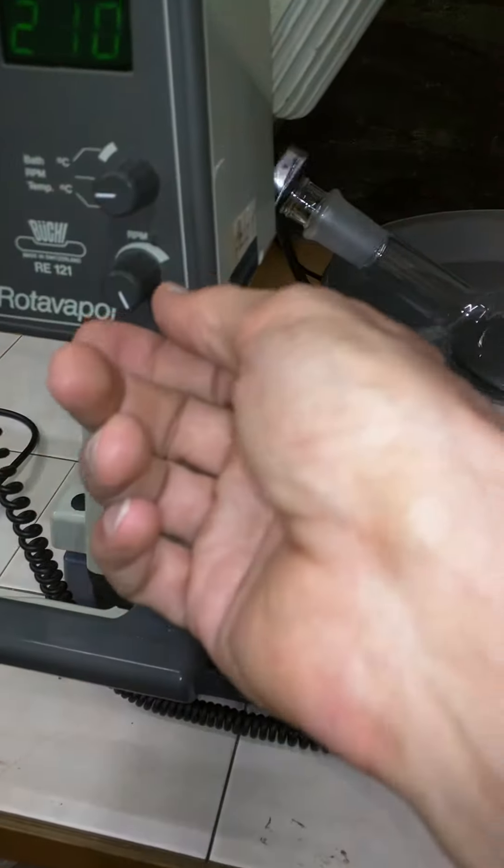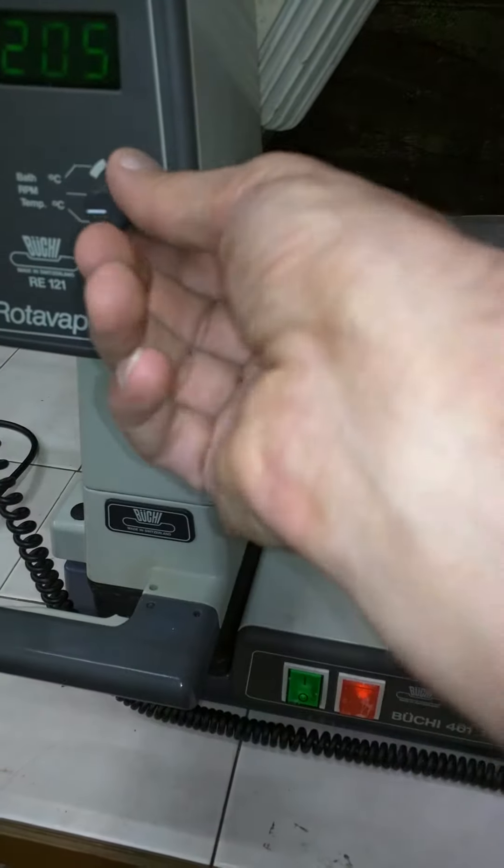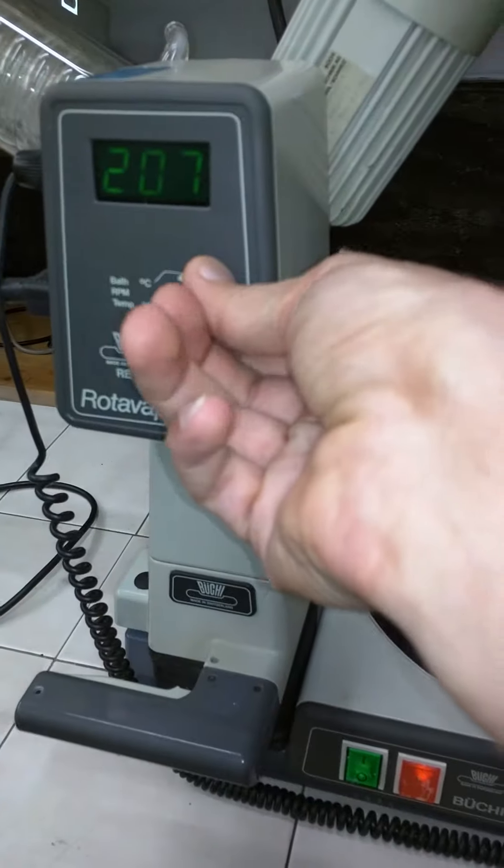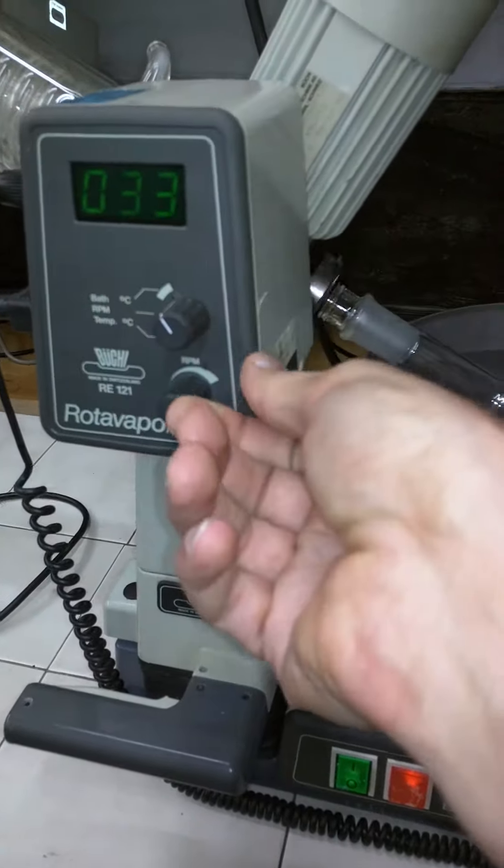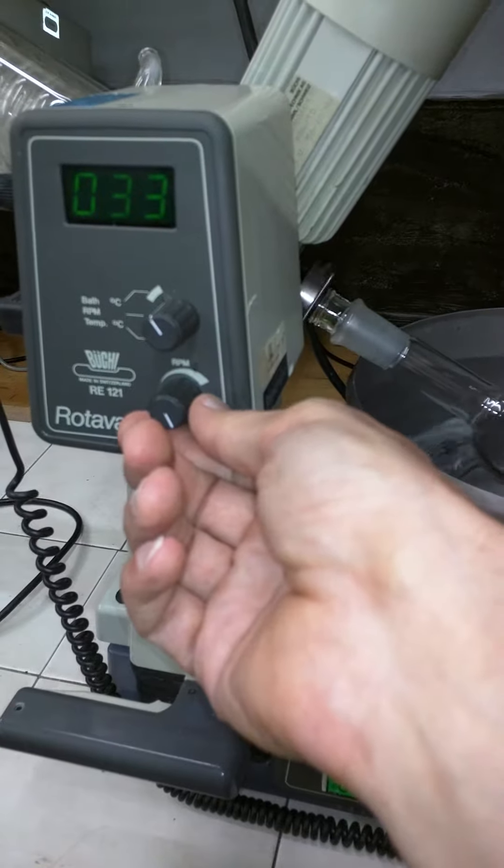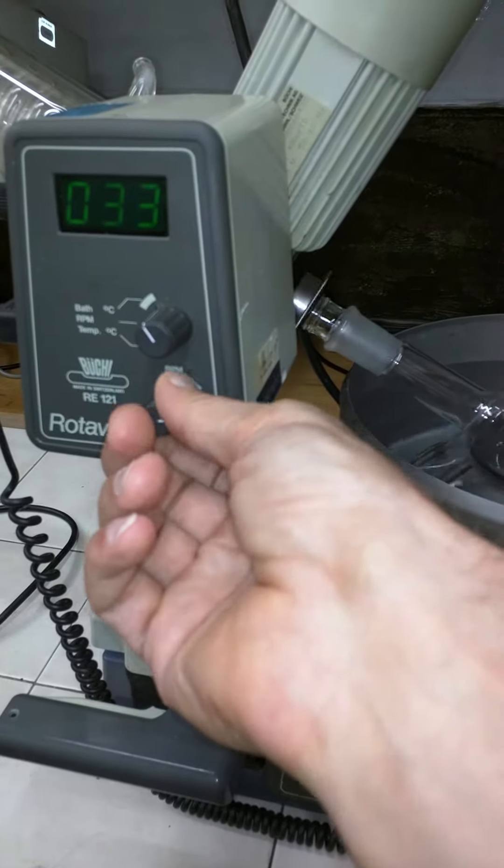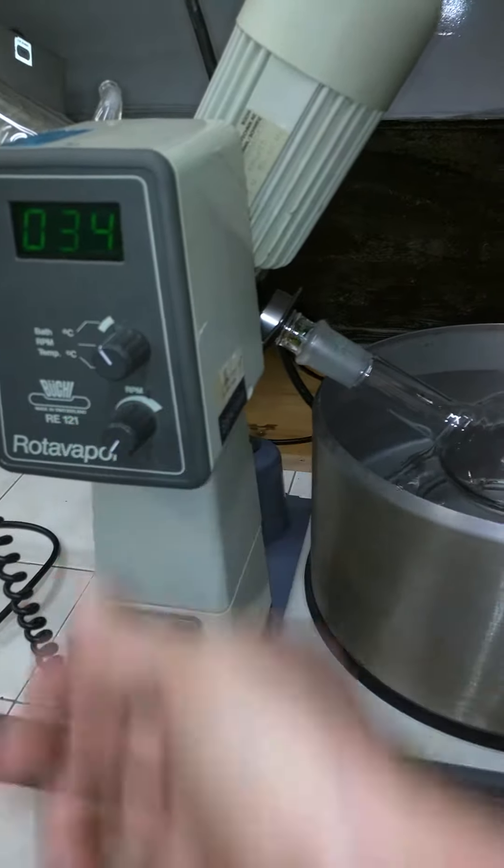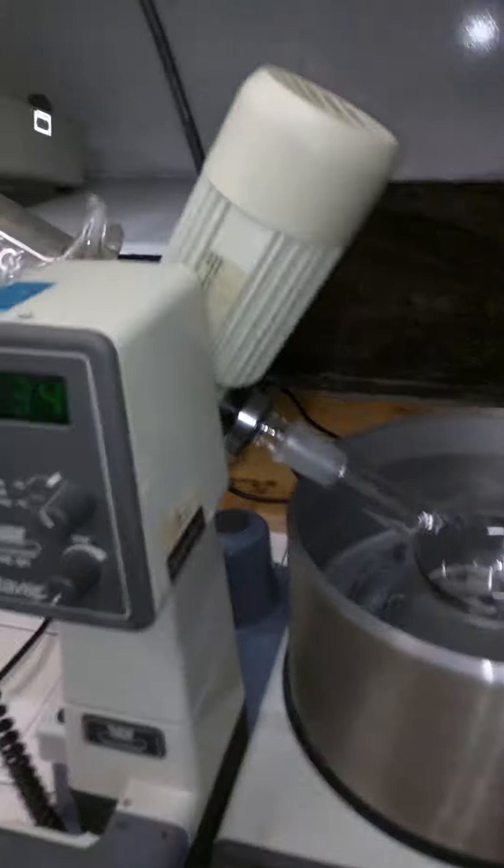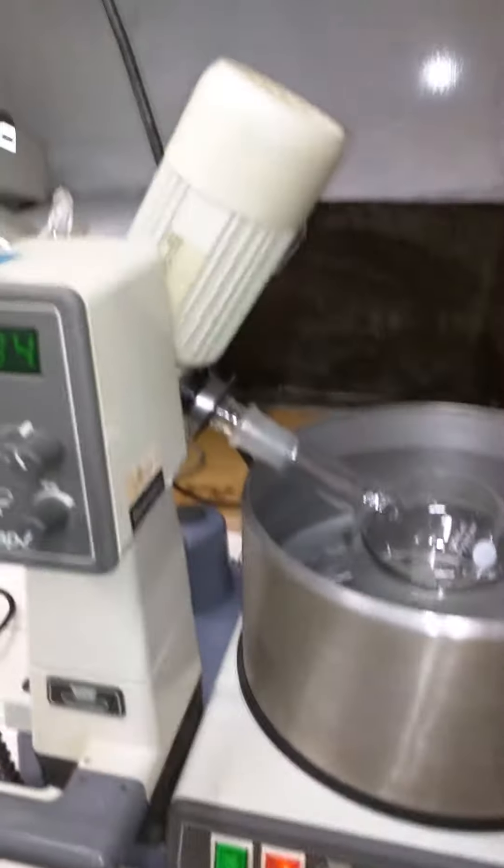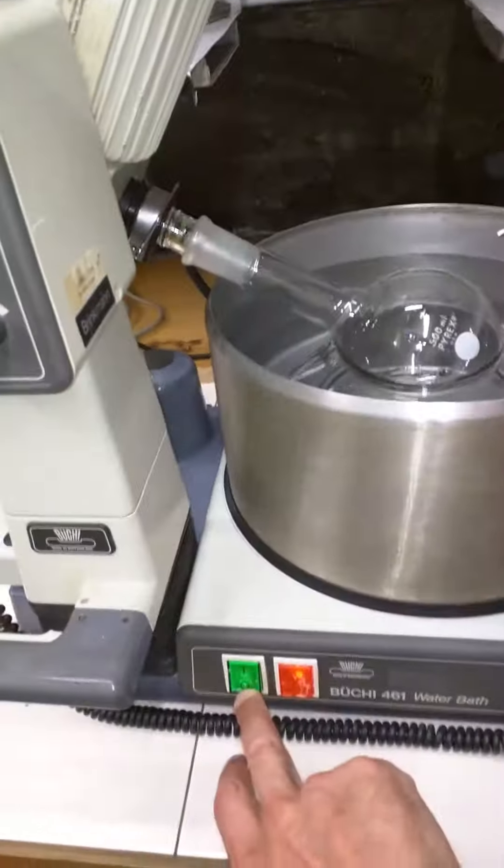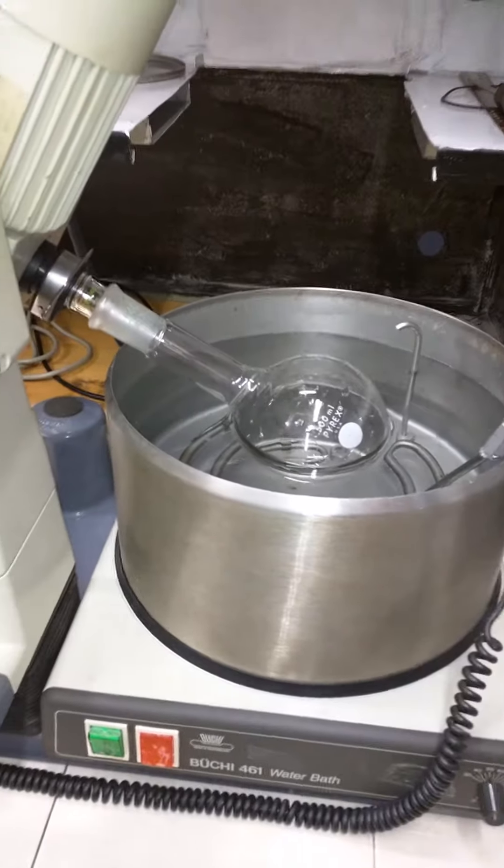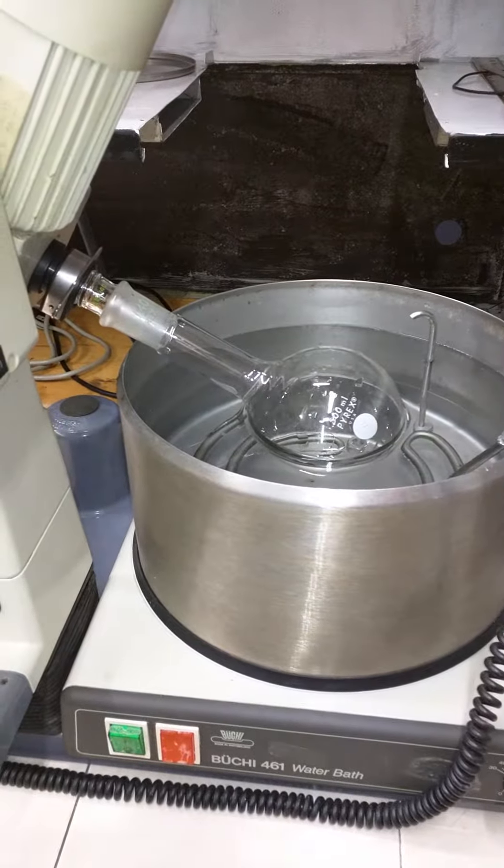Let's switch back to temperature - we're already at 33, 34 degrees, so I'm going to shut it down. It's stopped at 34. I'm going to shut it down here too. That concludes the video.